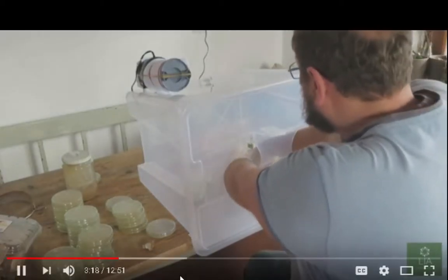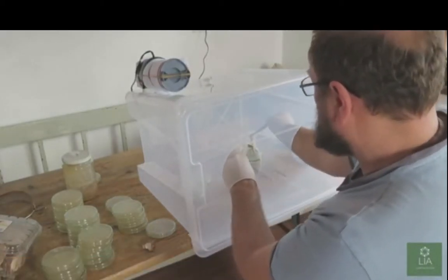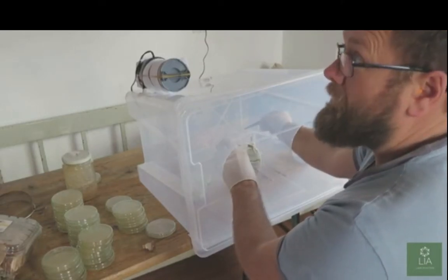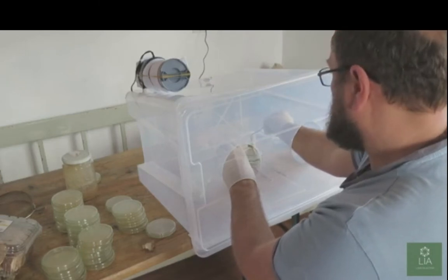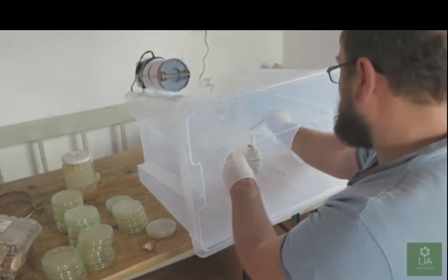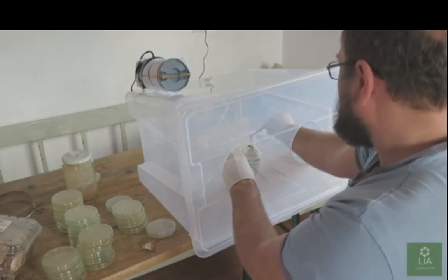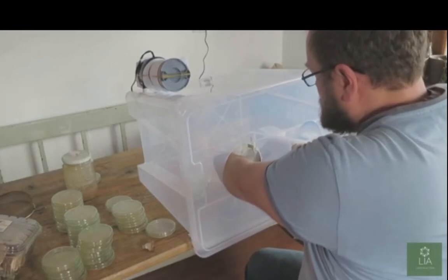Well, if you're taking a mushroom like this, you can use the hot blade to make the first cut on the mushroom. I'm talking too loud. Oh, I'm talking quietly. Okay, sorry, I've got my earplugs in. I can't hear a thing. Okay, so we're going to use a hot blade to cut the mushroom. Okay?